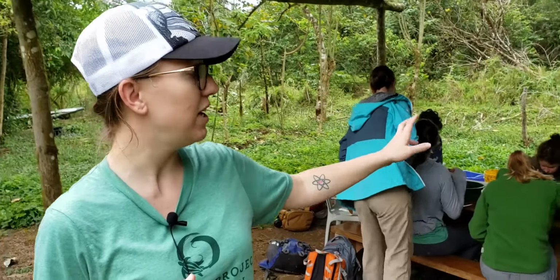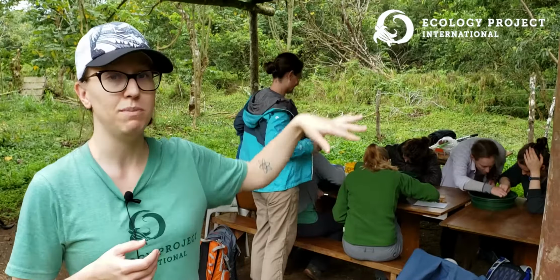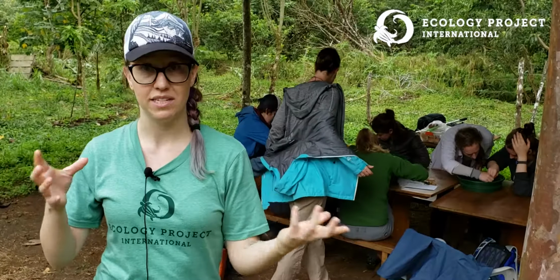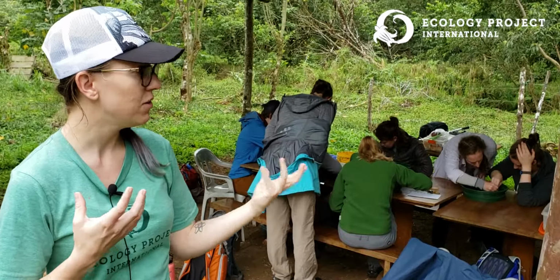We are actually looking at turtle stool samples for the seeds and the plants that they contain. So we have two different samples. One was obtained at a height of 206 meters above sea level, and then the other one was obtained at 60 meters above sea level. So we're looking at the different compositions of plants that grow there, because by looking at what the tortoises are eating, you can actually figure out what sort of plants are growing there, and then also if the tortoises are migrating, as they do, what sort of seeds are being carried to different environments, and then what seeds are thriving in those environments versus the ones that are not.